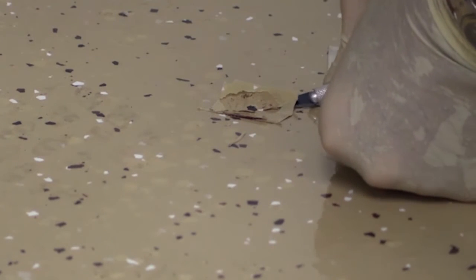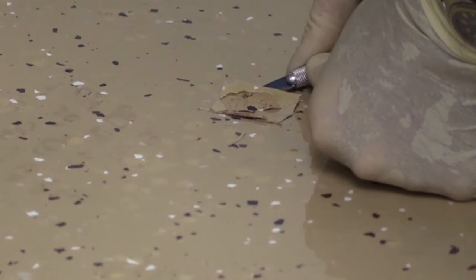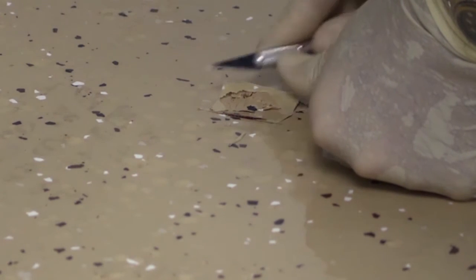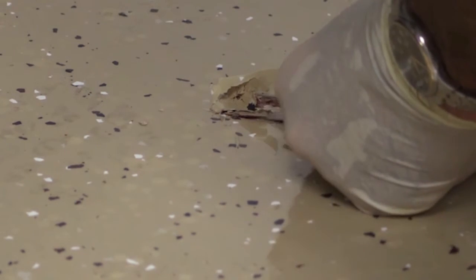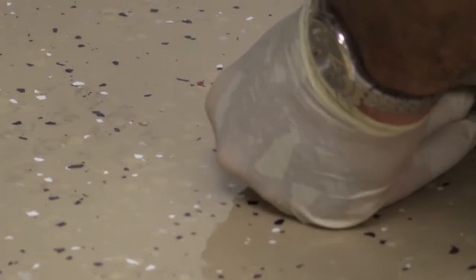See, all I'm doing is just making a series of short cuts in the coating system underneath. So there we go. So we have the sample there. What I'm going to do is I'm going to photograph that while that sample is still there as sample three.